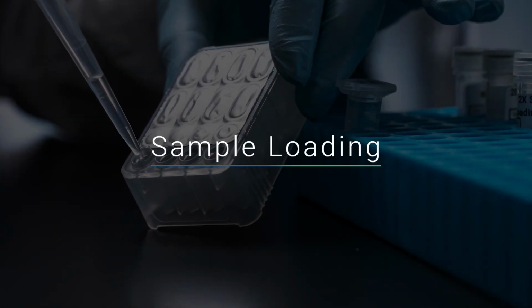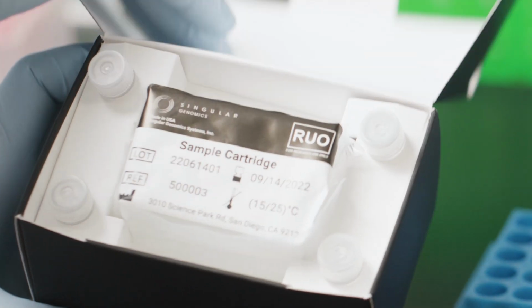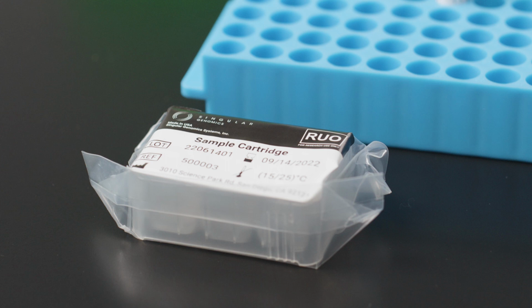In this video, we will review how to load denatured samples in the sample cartridge. The sample cartridge should be kept in its box until you are ready to add samples. Do not expose the sample cartridge to light for any extended period, as this can compromise the stability of the diluted bleach solution contained in the sealed wells of the cartridge.